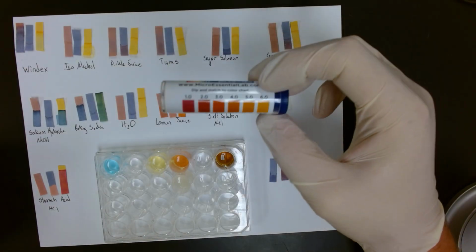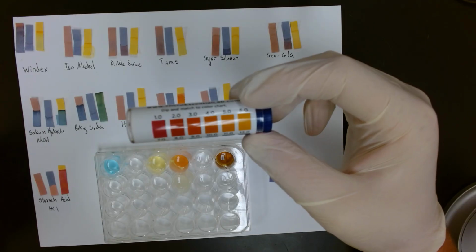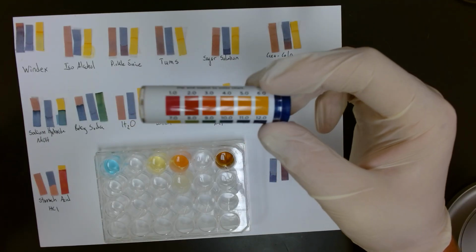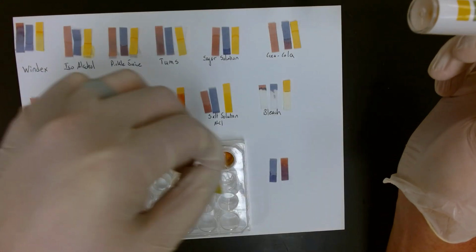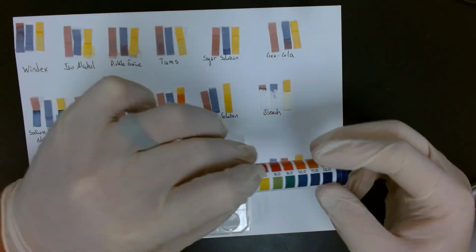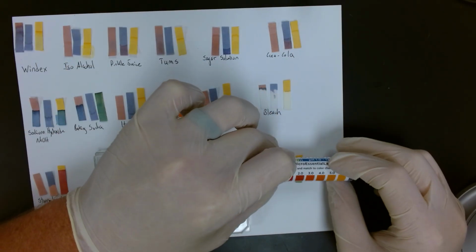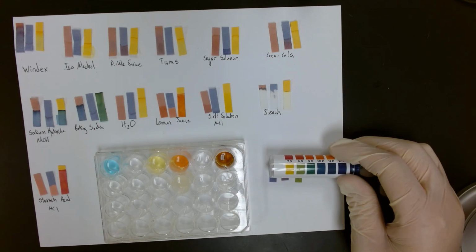Up next, we will test the hydrion paper, and this gives us much more of a range. It does more than just turn red or blue. Again, we dip that into our solution, lay it out, and then use our color code to match what we have. We'll see that this matches, to me, the 8 fairly well.